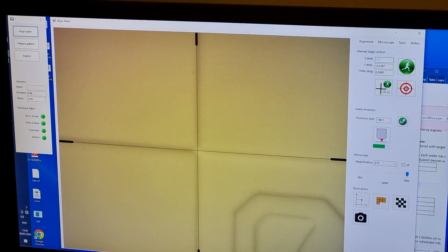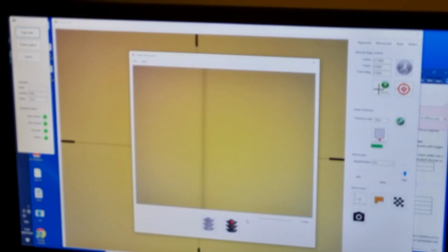Now we move to the approximate location of the 27, 0 alignment mark by typing in 27mm in X and 0mm in Y under Manual Stage Control. Once there, run the image tiling feature to locate the center of the mark.